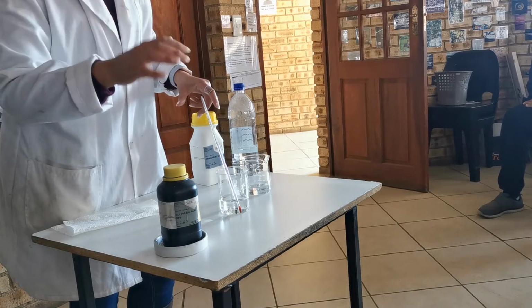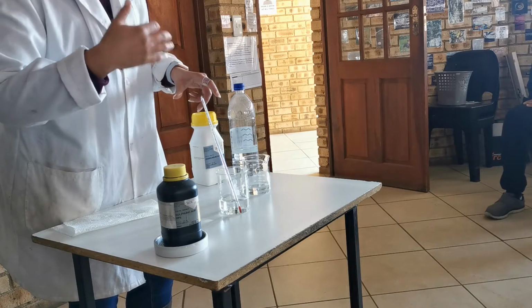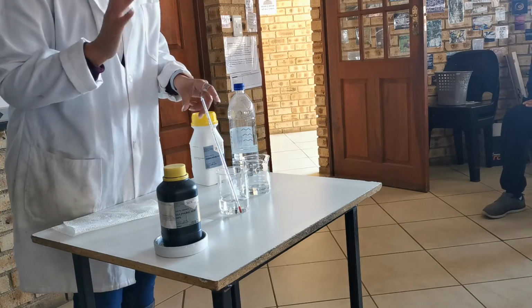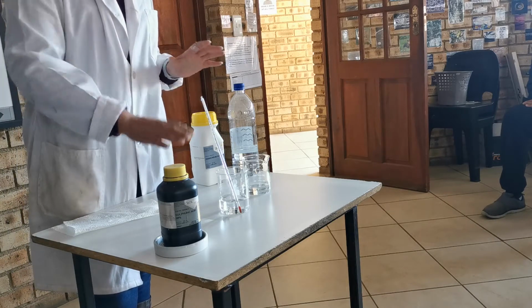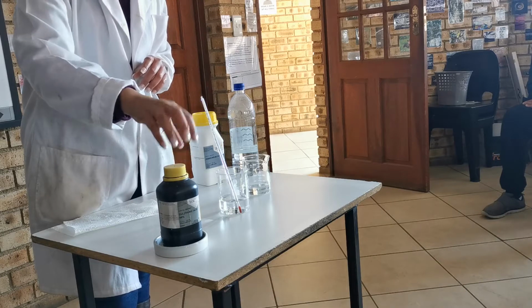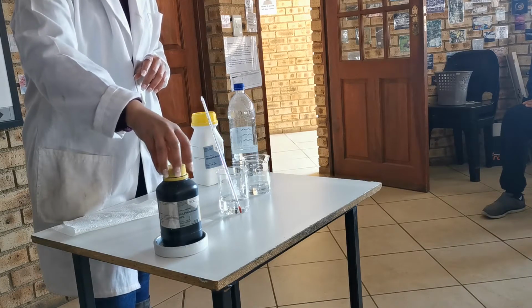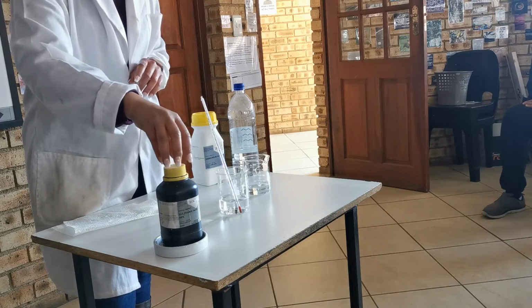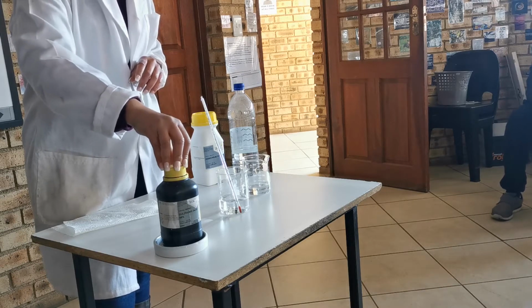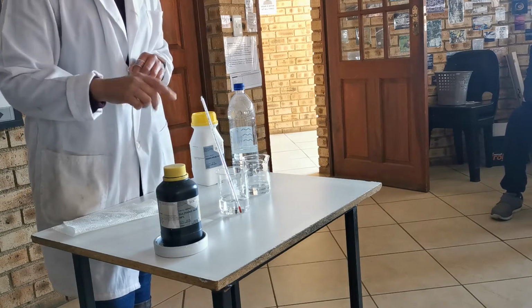Whenever we do an experiment with acid, we have a couple of rules that we have to adhere to, because acid is safety critical stuff. The acid that I'm using is concentrated sulfuric acid. That means that it will create a chemical burn on your skin. A chemical burn is not something that you want, firstly, but also it's not something that you expect.